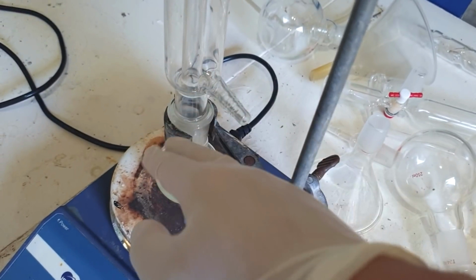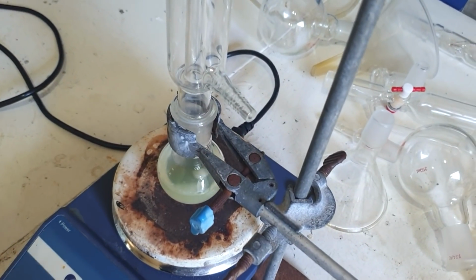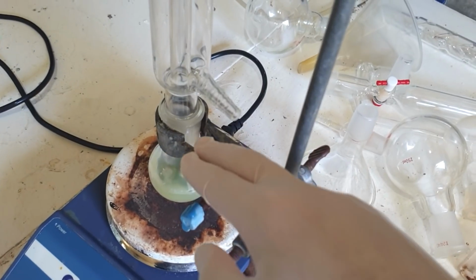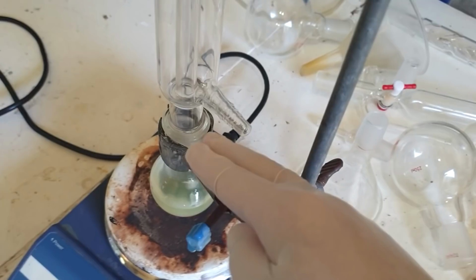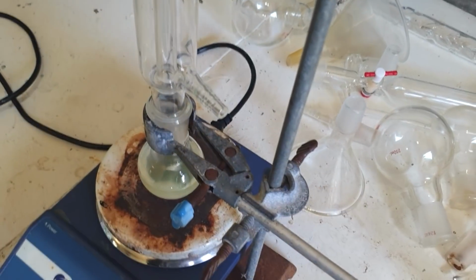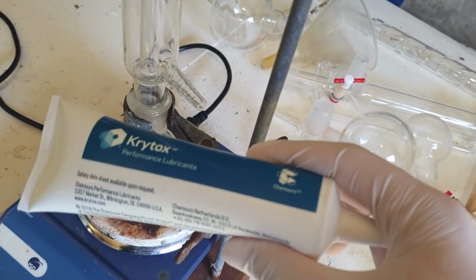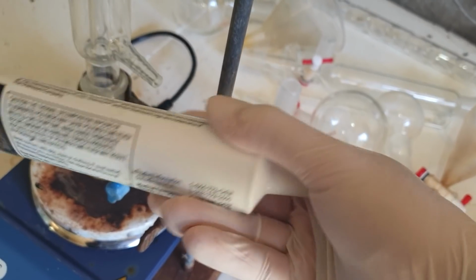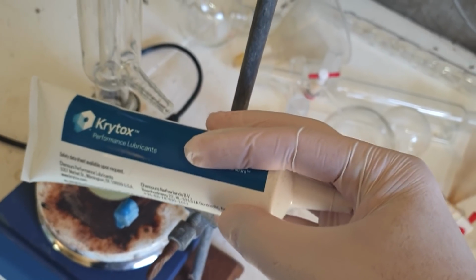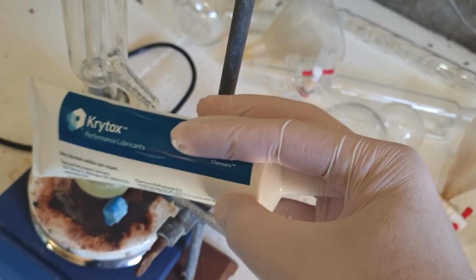And I don't want this condenser stuck to this flask forever, because it's one thing to have them stuck, but it's another thing to have them really seize and actually fuse together by the sodium hydroxide, because then you can never get them apart. So I've got this brand new grease. This is some very expensive stuff. This is the proper fluorinated stuff, and it's a whole lot of it. So this is probably the most expensive lube you'll ever see.